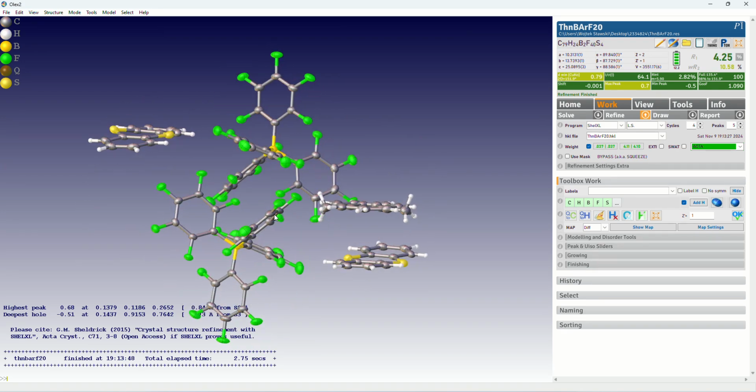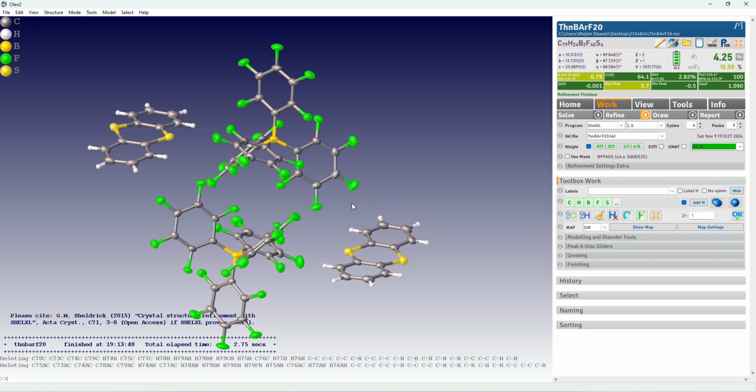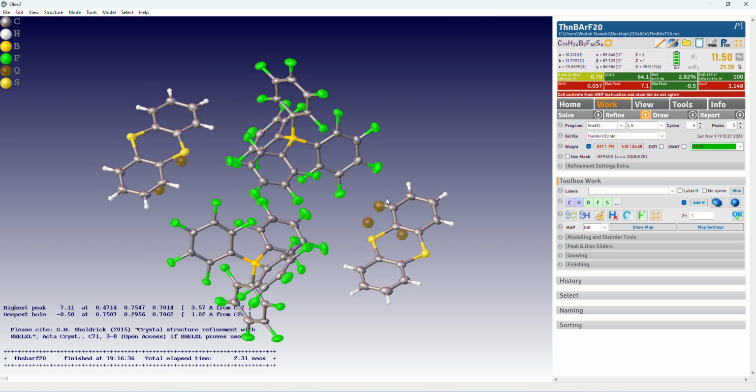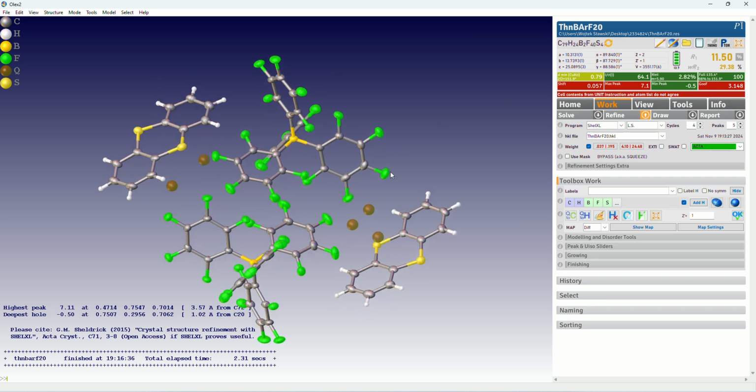So the first thing we need to do is to, well, delete solvent. So we delete that molecule, we delete that molecule, and we do the refinement. Now we have a model that doesn't have any solvent. Here we can see that there's a huge peak of maximum electron density and a large GooF. Yeah, we deleted important atoms, so that's why.